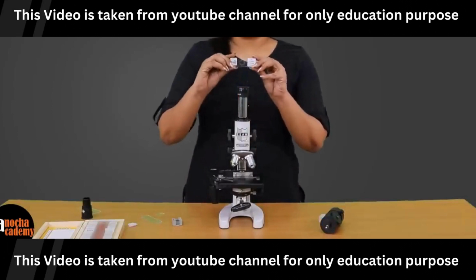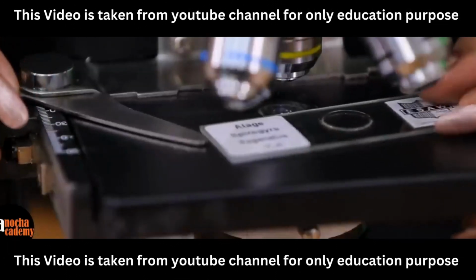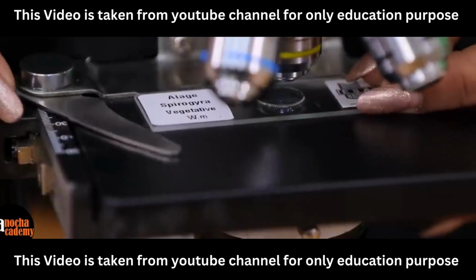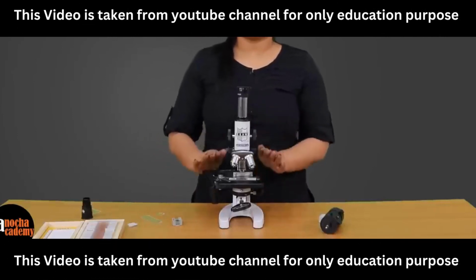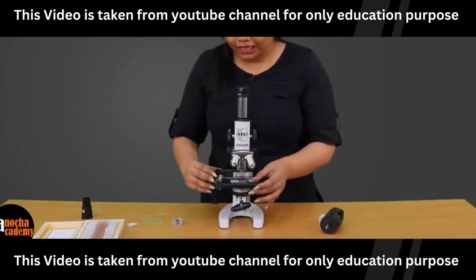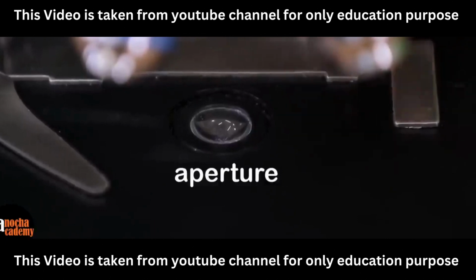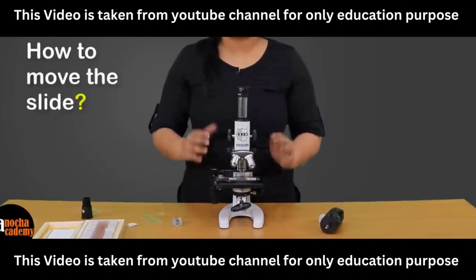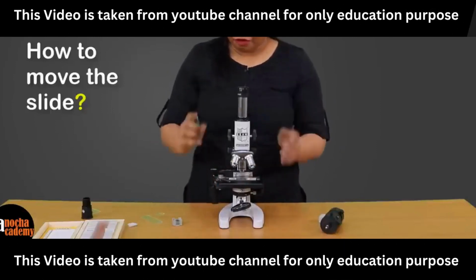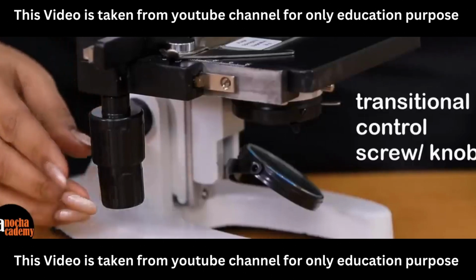So now what we'll do is take this slide, place it on the stage, and secure the position of the slide with the help of the clip. Now you have the slide on the stage. On the stage, there is a small aperture through which the light will enter and fall on the specimen. That is all right, but you might have to move the slide right, left, forward or backwards. For that, you usually have this kind of a screw attached to your microscope.